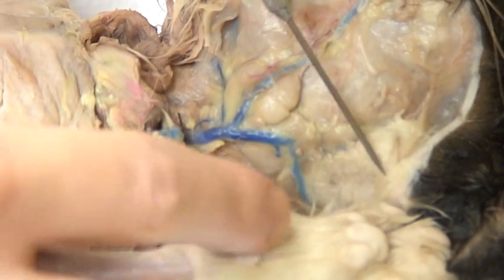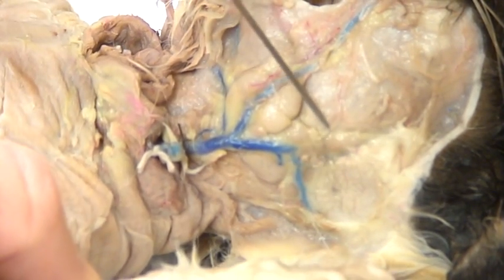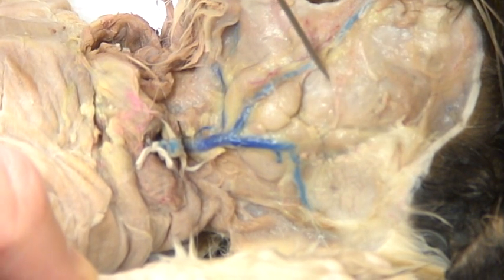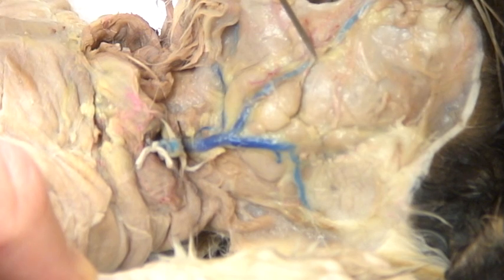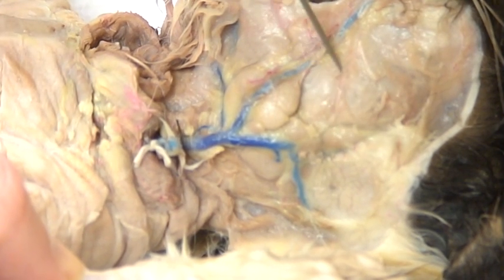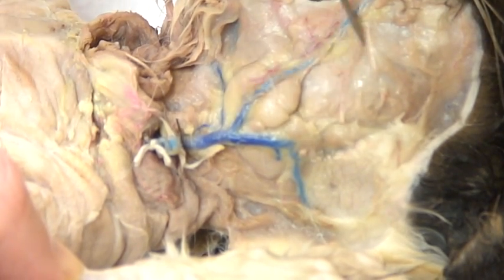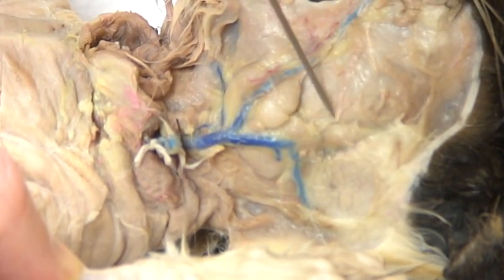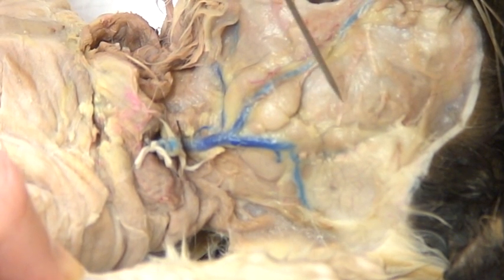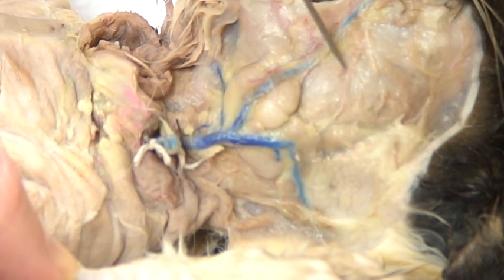This first one right by the base of the ear is called the parotid gland. If you look closely, there is a specific duct identified by a white string right along here — it runs right along the top of the masseter going right to the corner of the mouth. I'm separating it away a little bit so you can see it; it should be a white cord. We can see a little bit of it right here following its way all along. This is the parotid gland and this is the parotid duct.